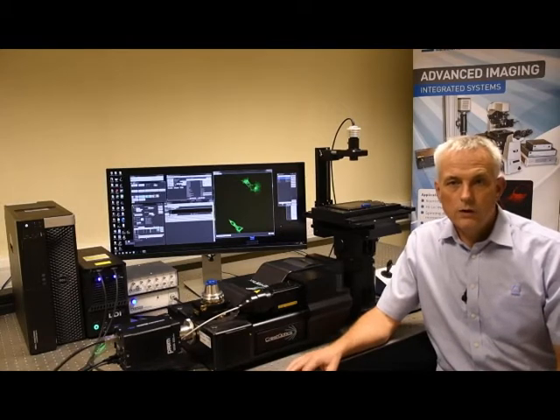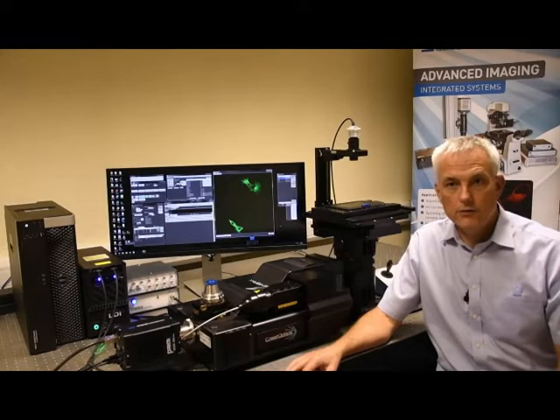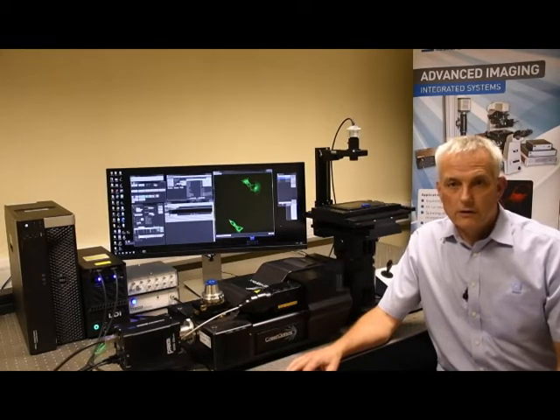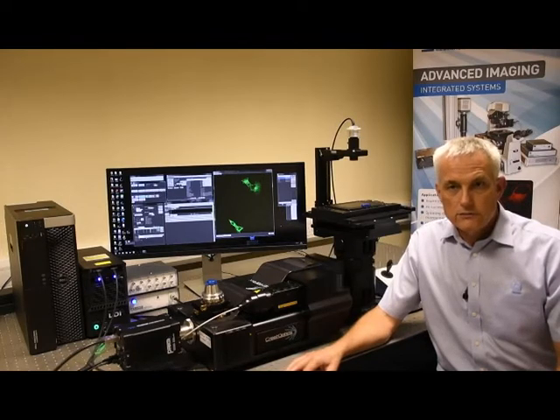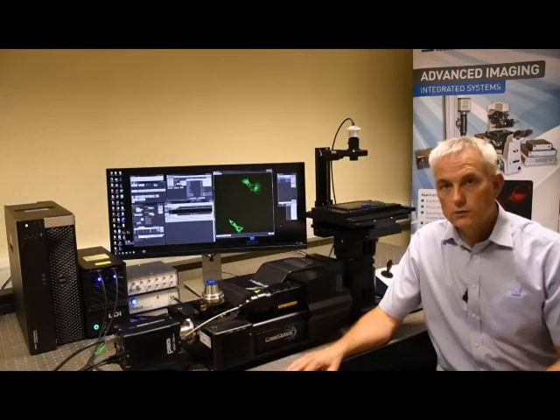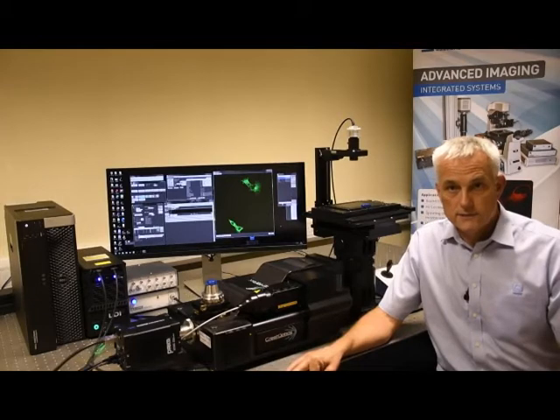Hi, welcome to Cairn's product presentation and thanks for your interest in our instrumentation. I'm Martin Reynolds, the head of our advanced imaging team, and this afternoon I would like to talk to you about our spinning disk confocal upgrade for quantitative fluorescence imaging from low-light samples.